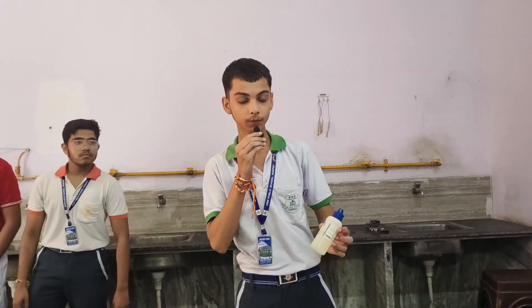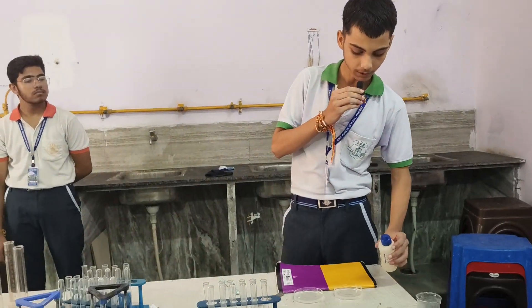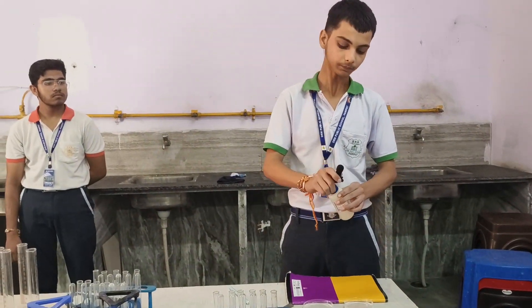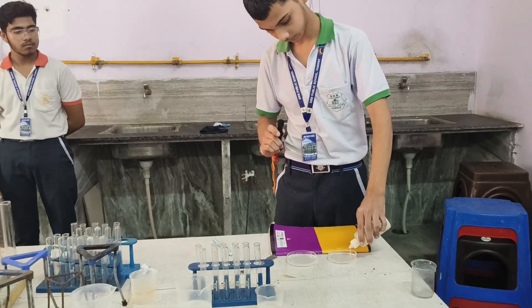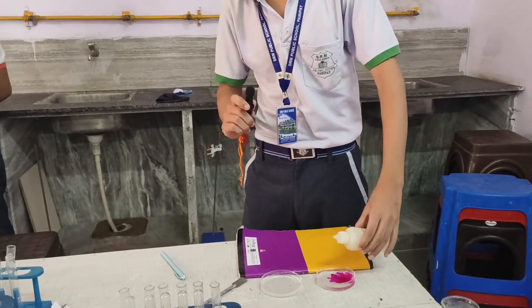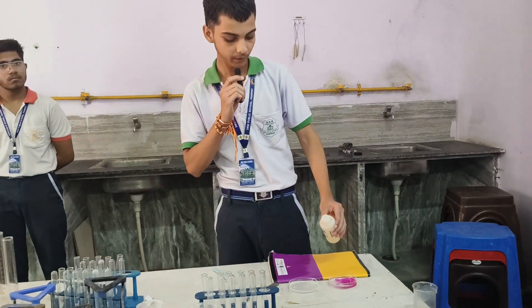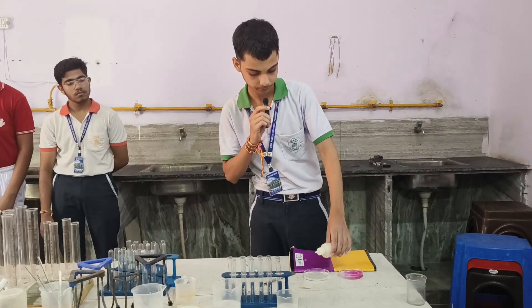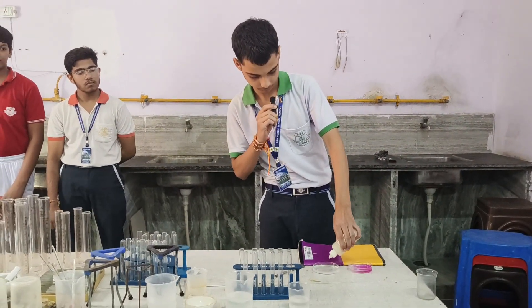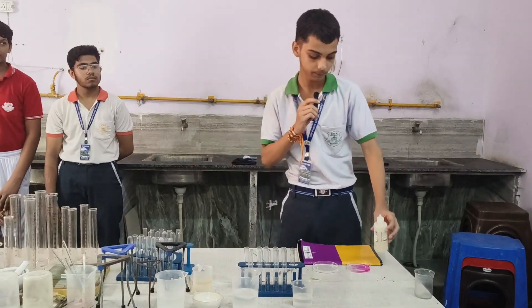This is phenolphthalein, a synthetic indicator. Now we will put some drops in base — there is a color change to pink. Now we will put some drops in acid — there is no color change.